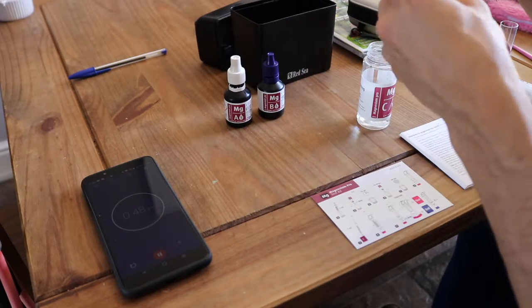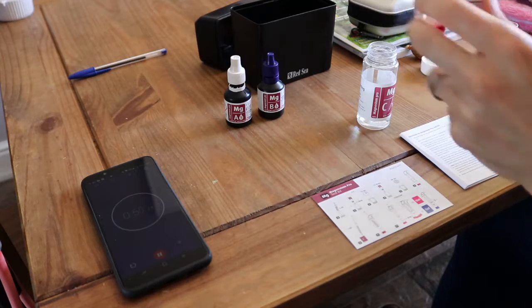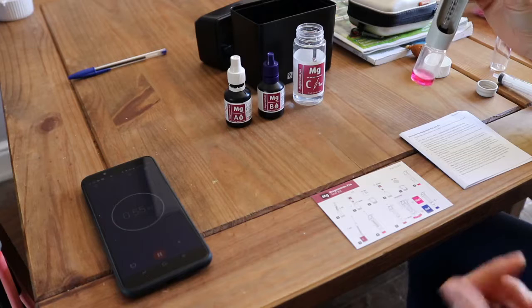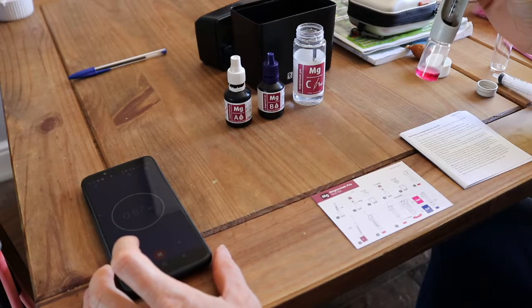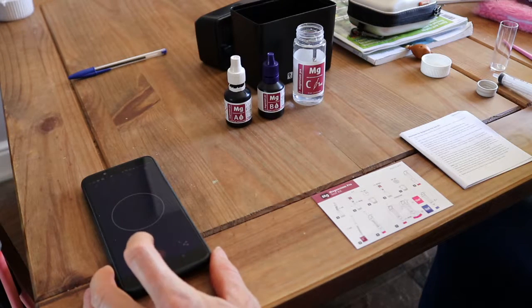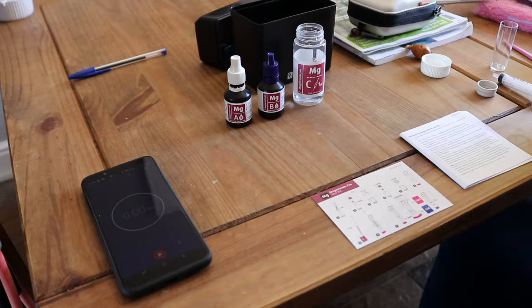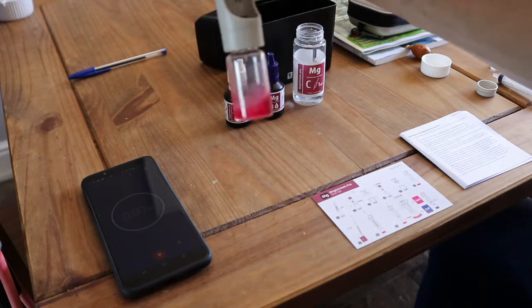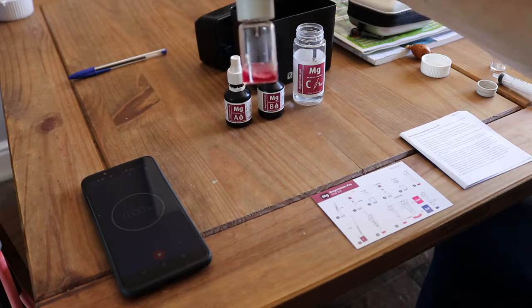There were points when I was doing this, I was literally dropping titration straight away, but as I say, Red Sea are adamant that you leave it 60 seconds, so we're just coming up on that now, and then we'll start going. So, the manual, you might not have read it, but it does say you can drop the first 0.4 ml of titration straight into the vial. So we've done that, and then you can start dropping.